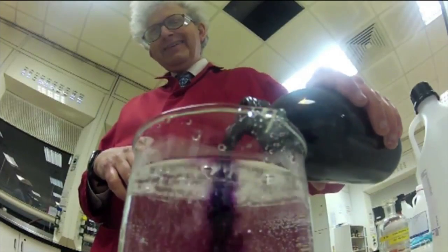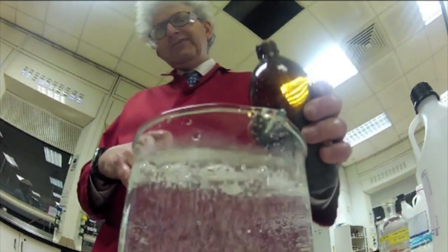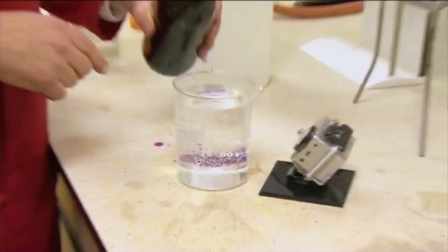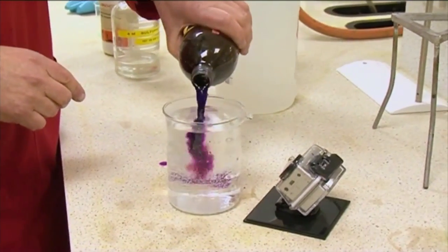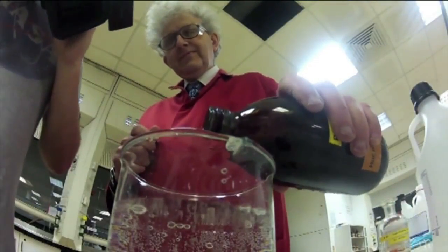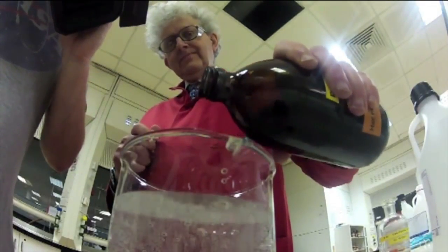That's brilliant. And you can see it's releasing oxygen from the hydrogen peroxide. So when it hits the surface, the manganese, which is bound to oxygen in permanganate, reacts and loses its oxygen and forms manganese ions, manganese 2+ for those of you chemists, which are completely colorless. So it goes from this very intensely colored salt to the colorless one.